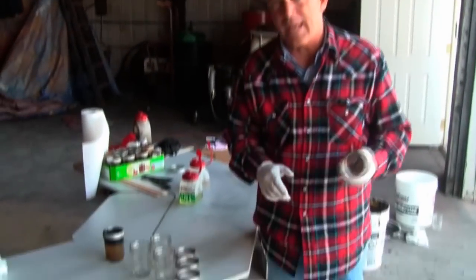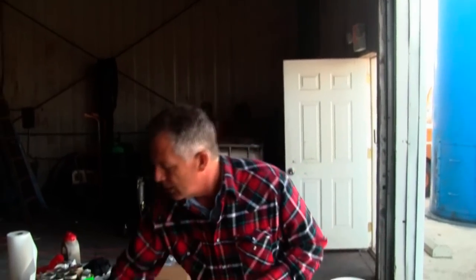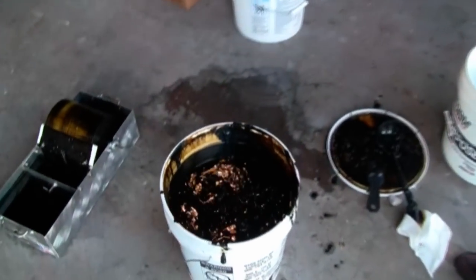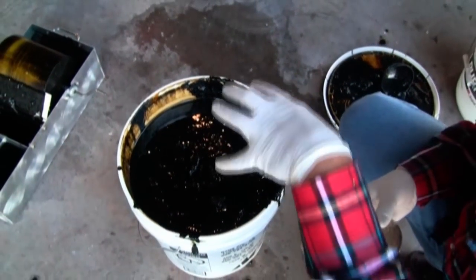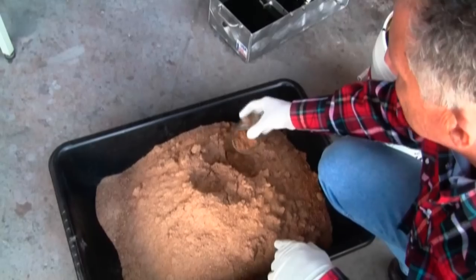What we're trying to do today is sample the separation of hydrocarbons from soils to recycle and gain a product rather than just remediate it. This is a sample we've just done briefly where we were separating soil. This is crude oil from West Texas, sent by the client, and as you can see there are floating solids of both soil and paraffins. We're going to add some raw soil so you can actually see the separation very clearly, like we just demonstrated.